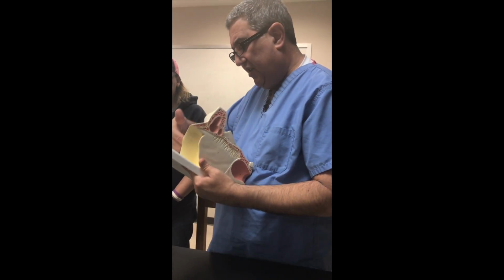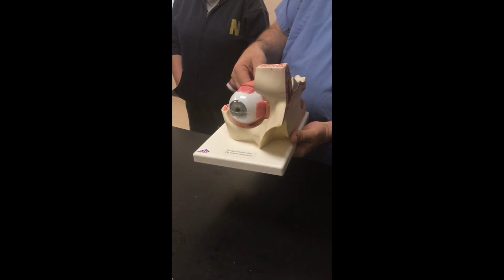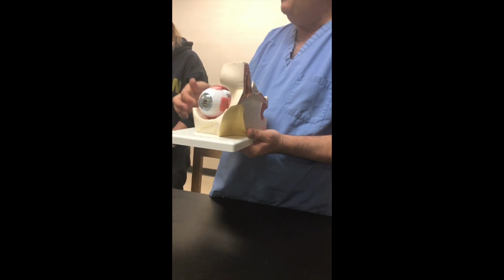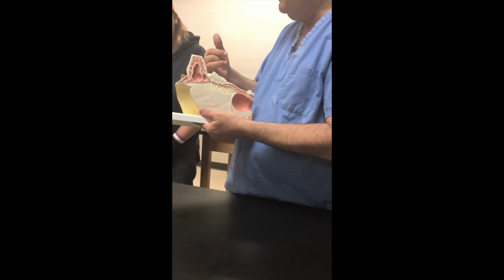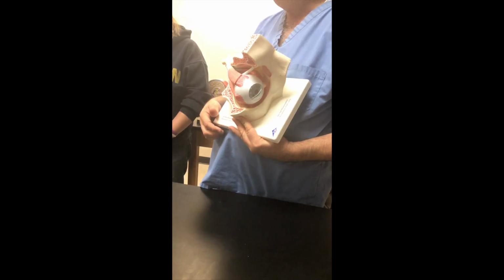And you can see over here, you can see the inferior oblique over here. So you should have no trouble naming these muscles. The straight ones, rectus: superior rectus, lateral rectus, medial rectus, inferior rectus. You can see over here the tendon of the superior oblique, and you can see the muscle over here for the inferior oblique. But can you see the trochlea over here? See that? That's where the tendon goes whoop, whoop. So, I hope you can see that.